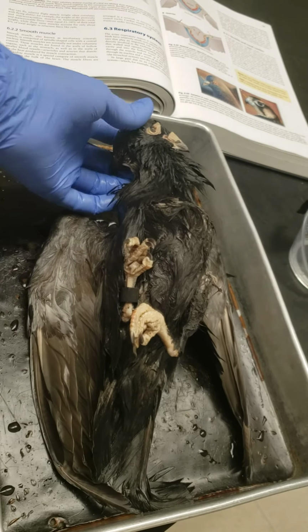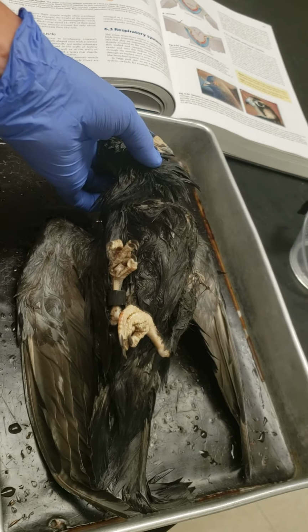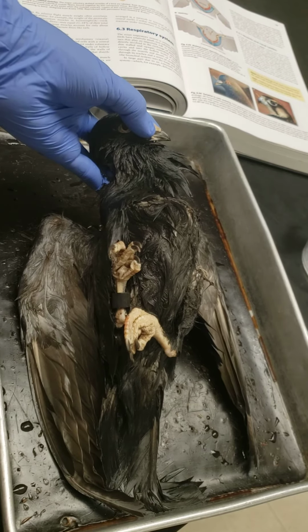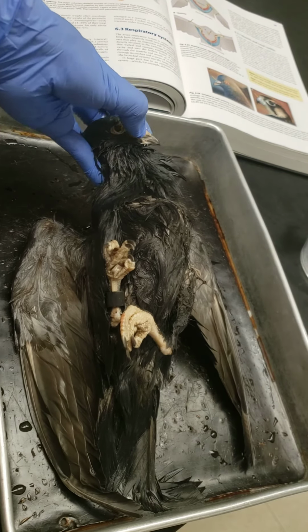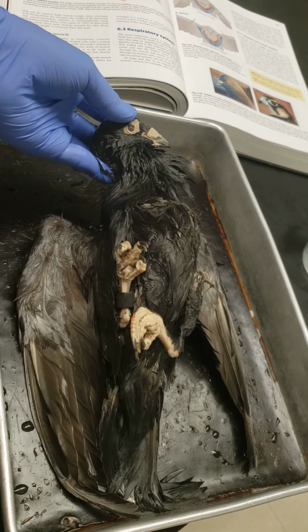So we also, on the outside of the pigeon, have the beak, and on the pigeon there's a little flap of a skin-type tissue called an operculum, which partially covers the nares. The nares is the nostrils, and that might help to keep out debris.